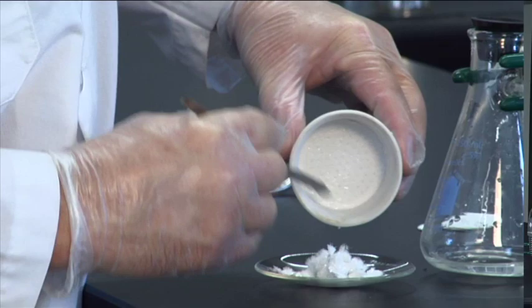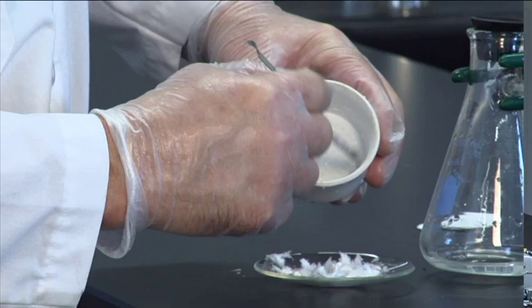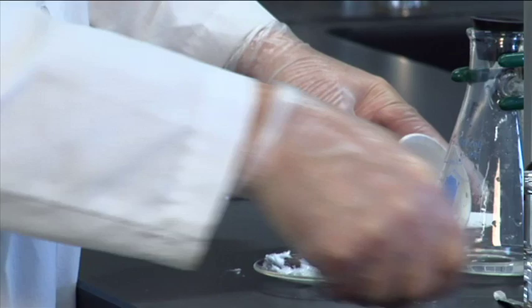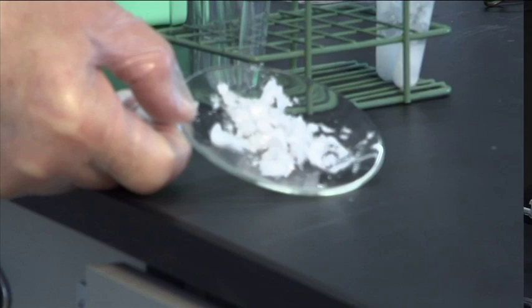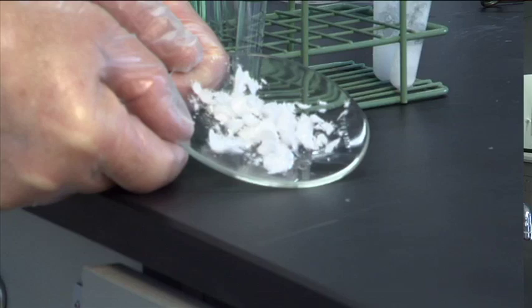And then scrape the filter paper once I get it onto the watch glass. All right. I'm going to spread some of this out so you can have a look at how nice these crystals are. Can you see that? There's lots of fine white needles. So benzoic acid makes great crystals. All right.